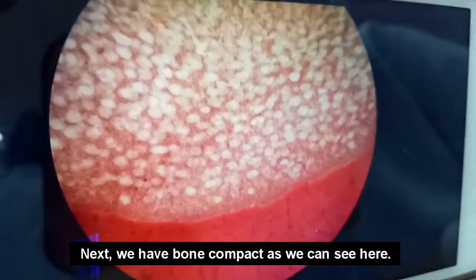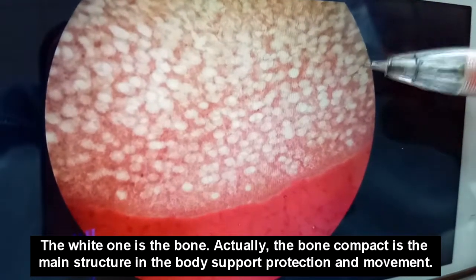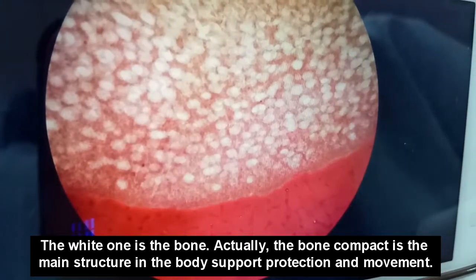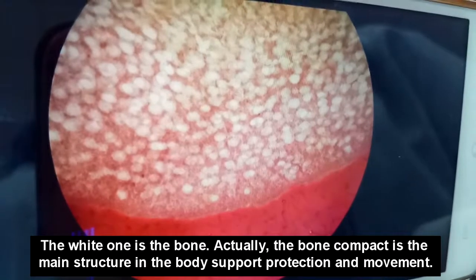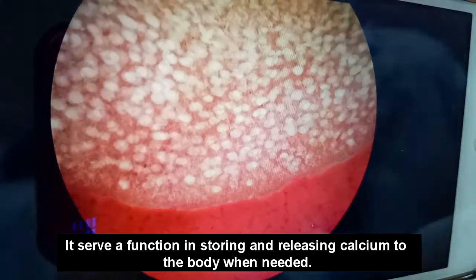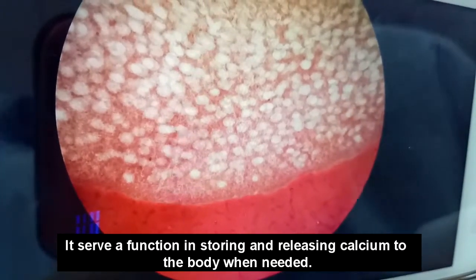Okay, next we have compact bone. As you can see here in the picture, the white one is the bone, and actually the compact bone is the main structure in the body for support, protection, and movement. It serves a function in storing and releasing calcium to the body when needed.